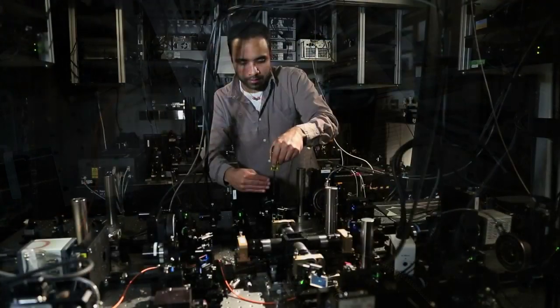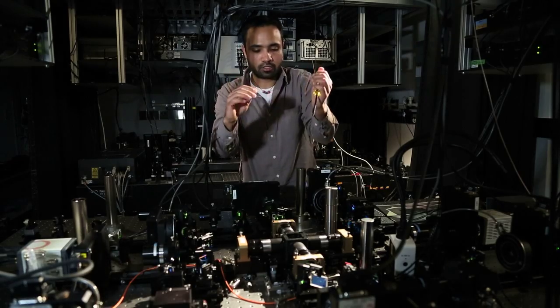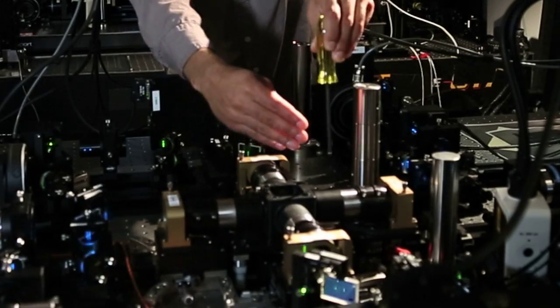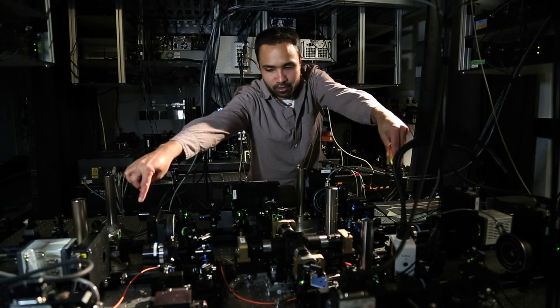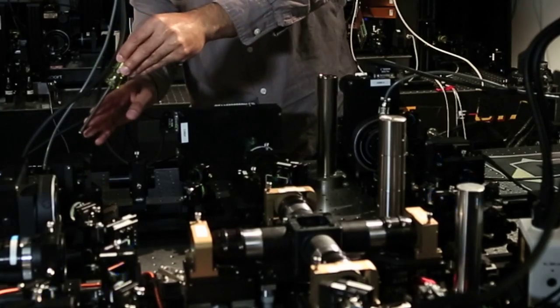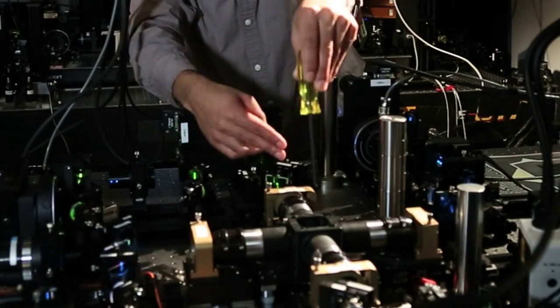So for this laser light that's going through to the chamber onto the sample, it illuminates the sample. Now the fluorescence is basically emitted in all directions, but those two cameras are now collecting that fluorescence light. So the light path for detection would be basically these two objectives, past these dichroic mirrors, past the tube lens, past the detection filters onto the camera. Whereas illumination is past the XY galvo scanner, scan lens, illumination tube lens, dichroic mirror, objective onto the chamber.